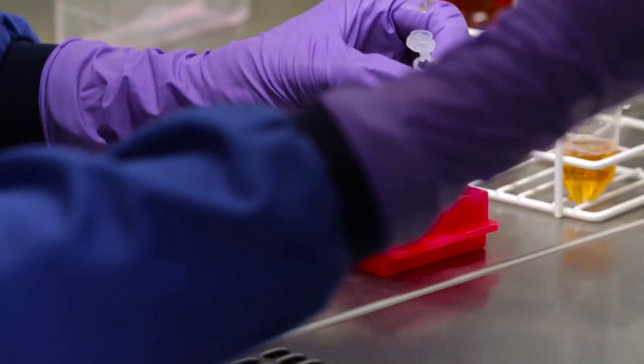Using a 5 milliliter sterile pipette, take a 0.5 milliliter sample of cell suspension and transfer into a sterile Eppendorf tube.